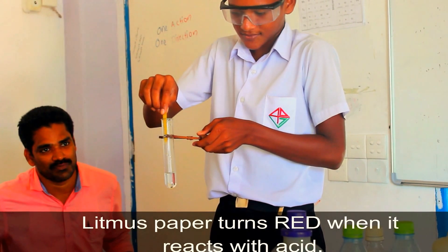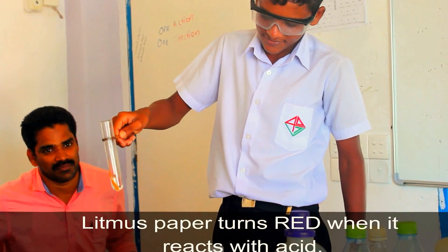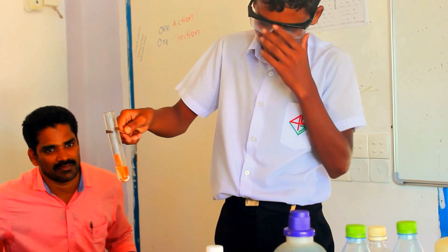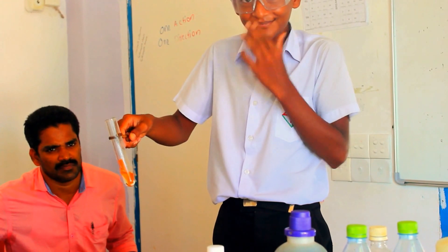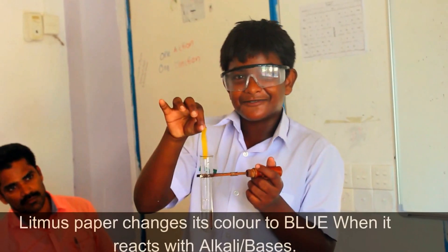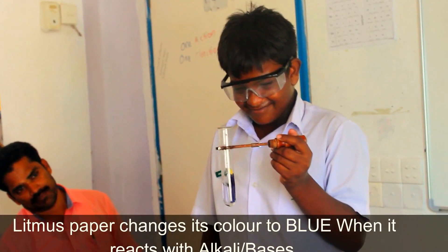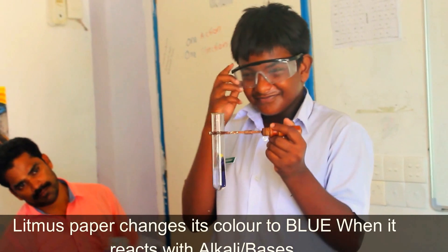Yanin's experiment shows that acid turns litmus paper into red. Isha is dipping his litmus paper into Sodium Hydroxide solution to see what happens.